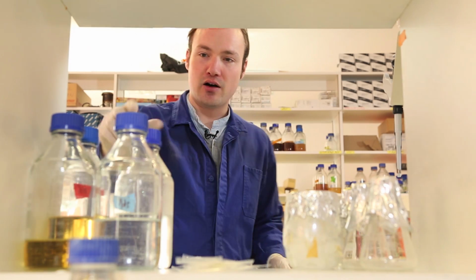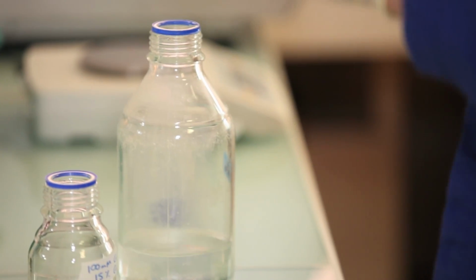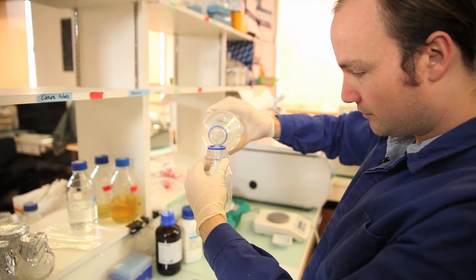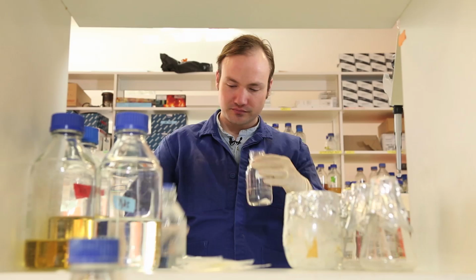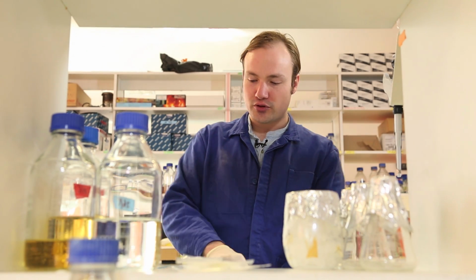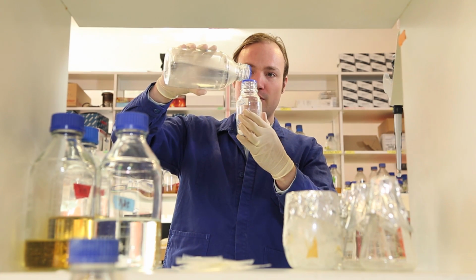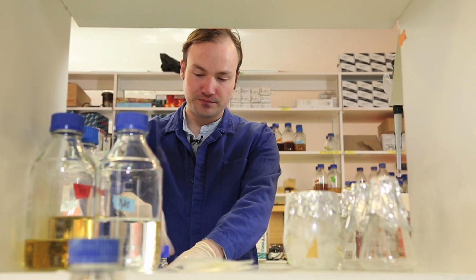Now I'm going to take my water and add it to the calcium chloride solution, bringing the total volume up to 100 milliliters. Pour that in, top it off at 100 milliliters. I'm also going to add some water to the calcium chloride and glycerol solution, but I'm not going to add the full 100 milliliters yet. I'm just going to take it up to 50 mils so that there's room left over for adding the glycerol.